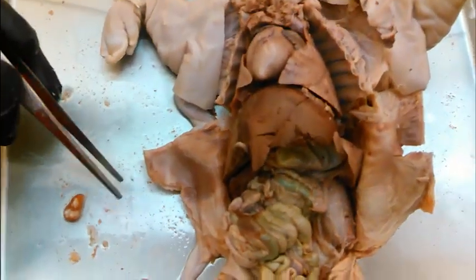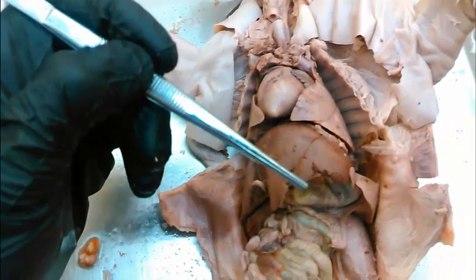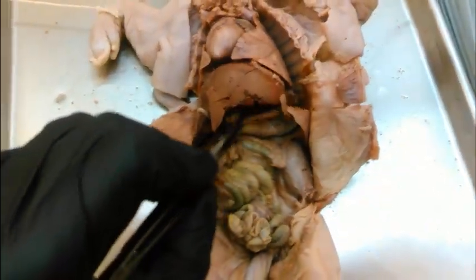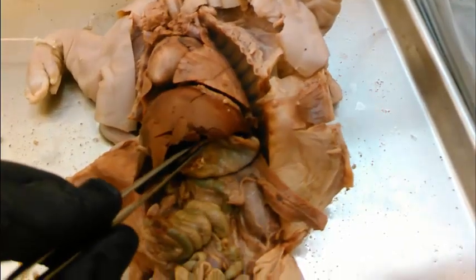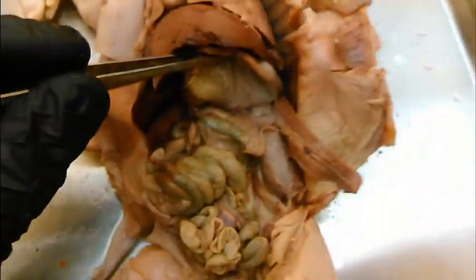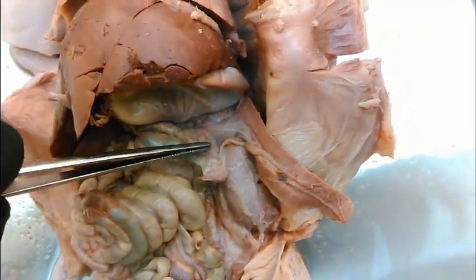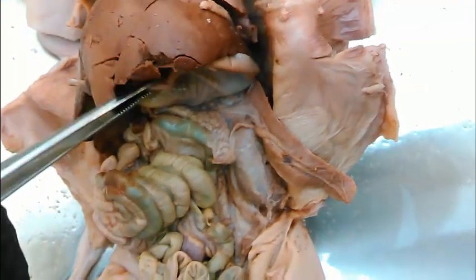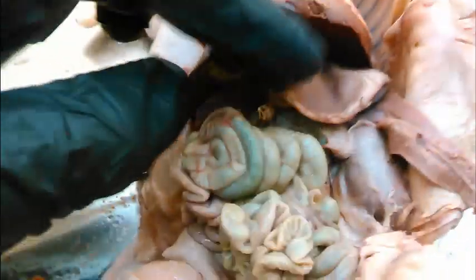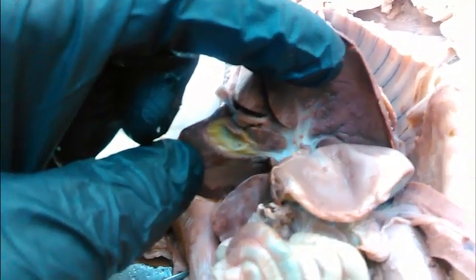Let me do a quick quiz. What is this thing? That thing is the liver. Under the liver — what is this big thing? I'm going to move the spleen out of the way and disconnect it. What is this? That again is the stomach. What is this structure? That is the pancreas. And let me move the stomach back down — look under here. What is that structure? And that is the gallbladder.